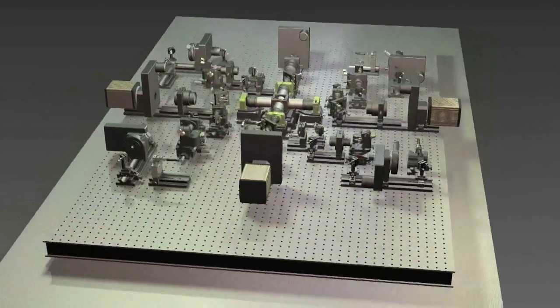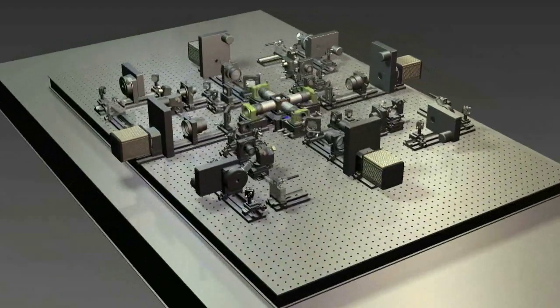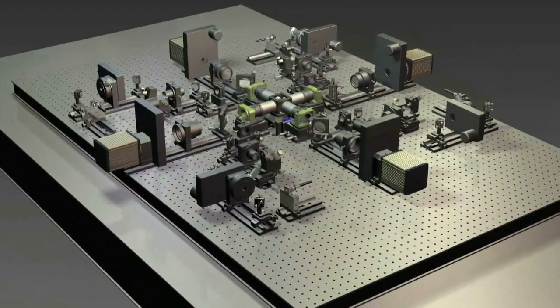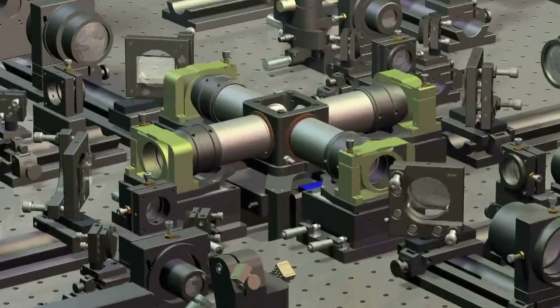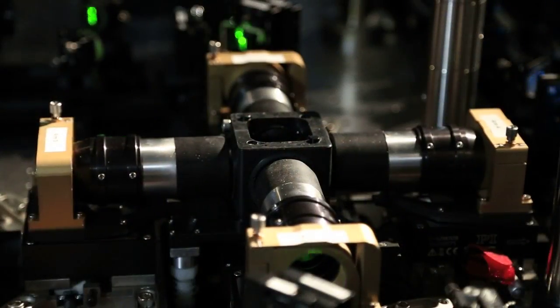And now for the first time, we really have the system that allows us to do live imaging of a fairly large, not particularly transparent sample, as is the case really in most specimens in biology, with both high temporal resolution but also high spatial resolution at the same time.